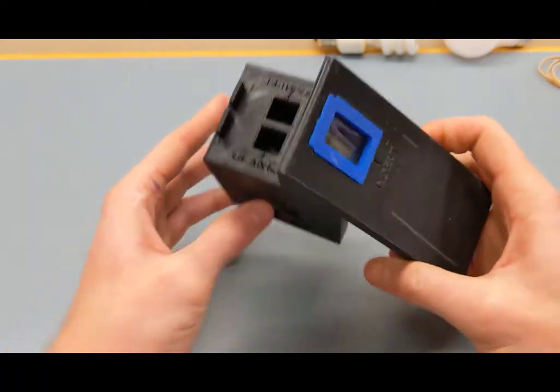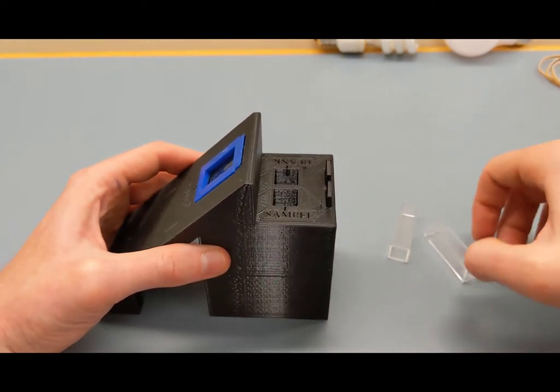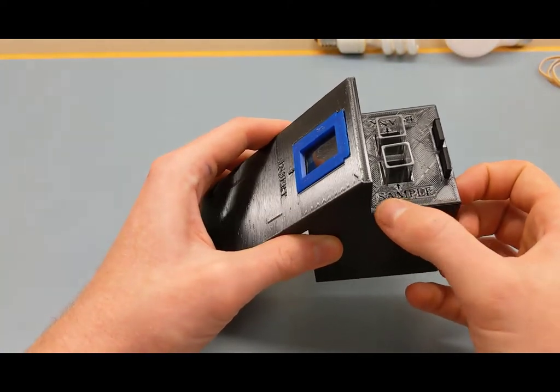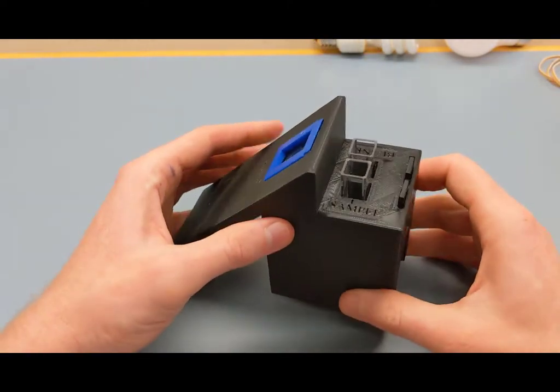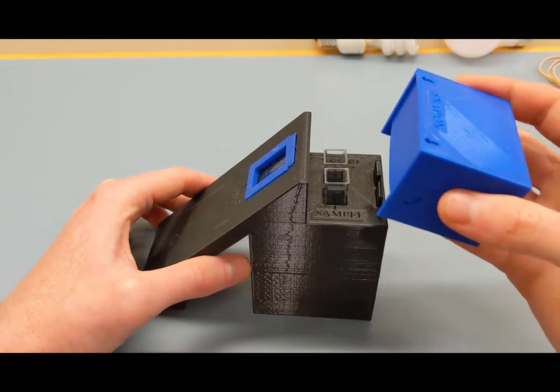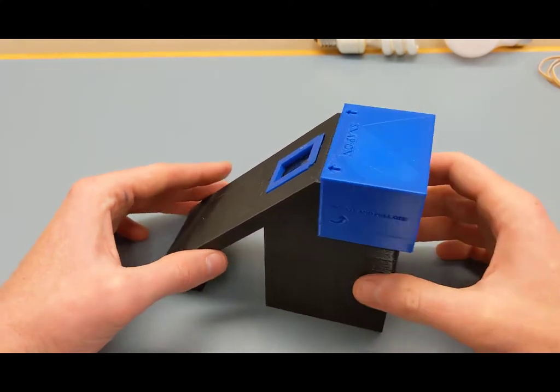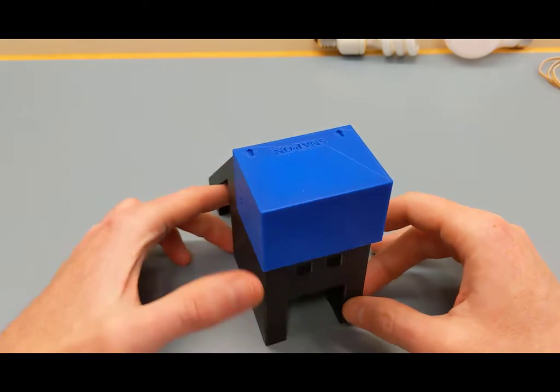The entire spectrometer is now assembled. The last two steps are installing your cuvettes, which are removable and housed here — one position is for your sample, the other for the blank. The final included piece is the cap, which slips over the top. It's not perfect but blocks light coming in from above and provides a darker background for the image formed on your camera.